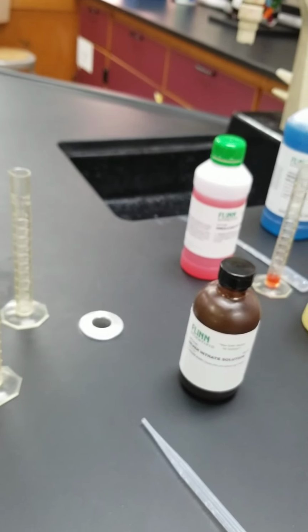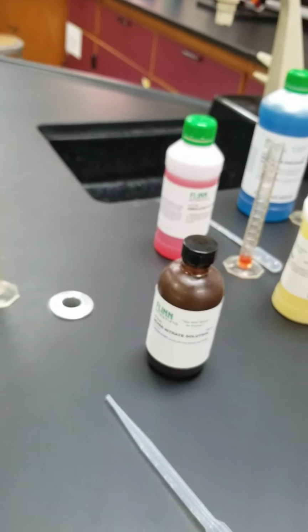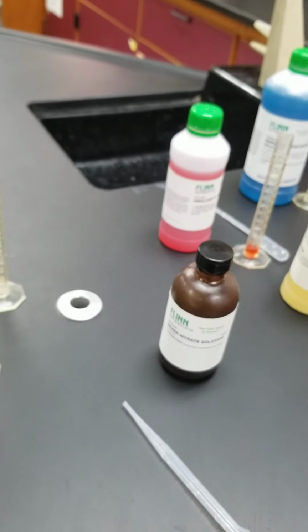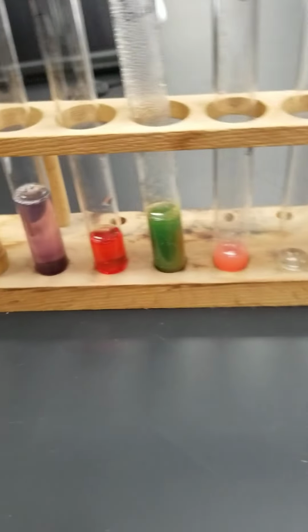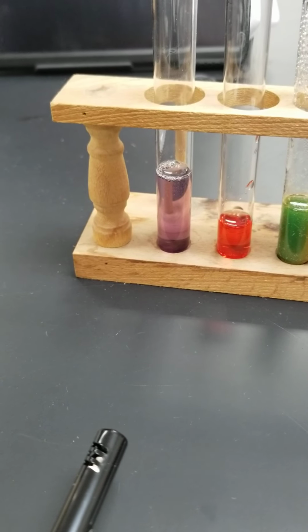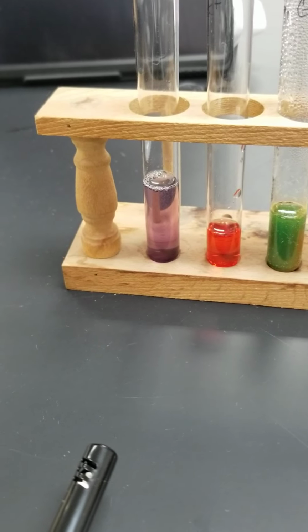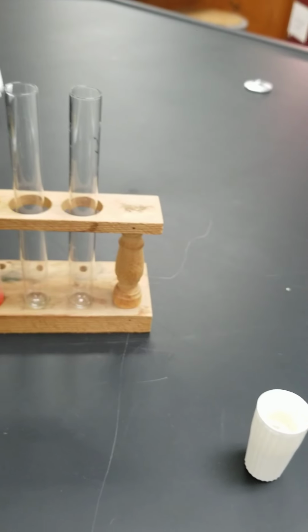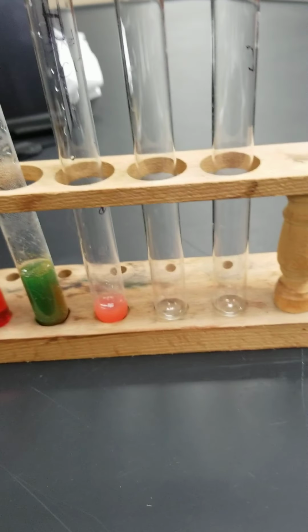Okay, I'm just checking through to make sure that you saw everything you were supposed to see. Oh, flame test. So the color flame you should have seen would also have been kind of a lavender color. So go ahead and record that the flame changed to a purple or lavender color for the blood analysis, where we were testing for the presence of sodium and potassium.